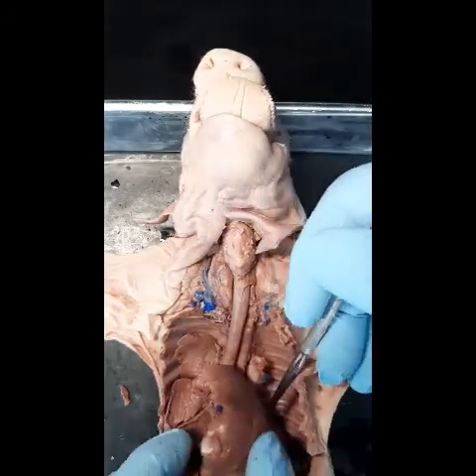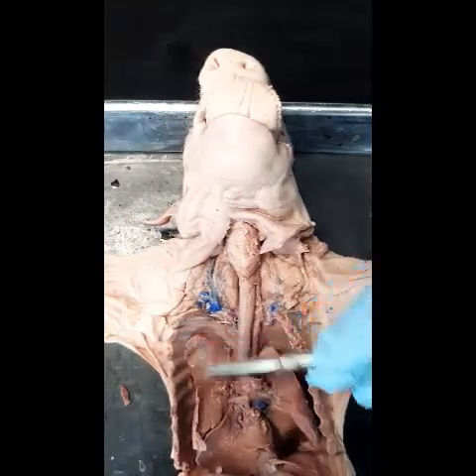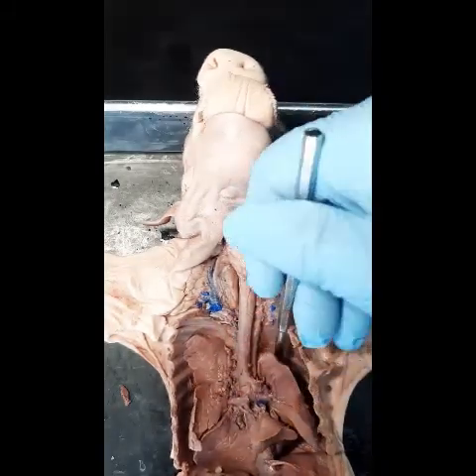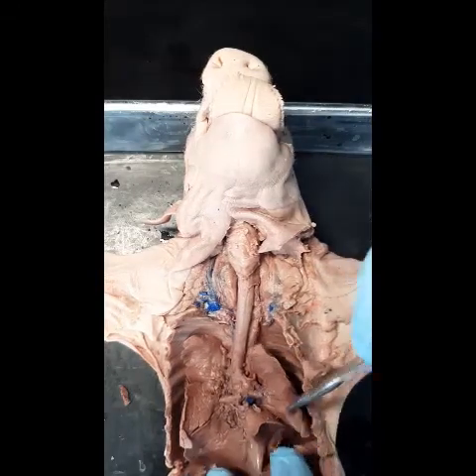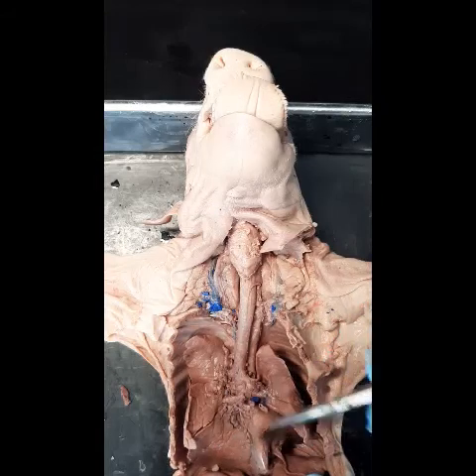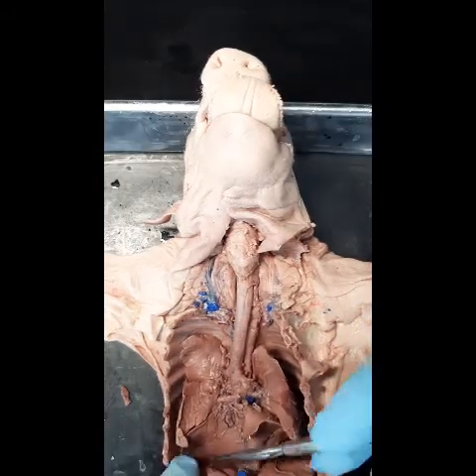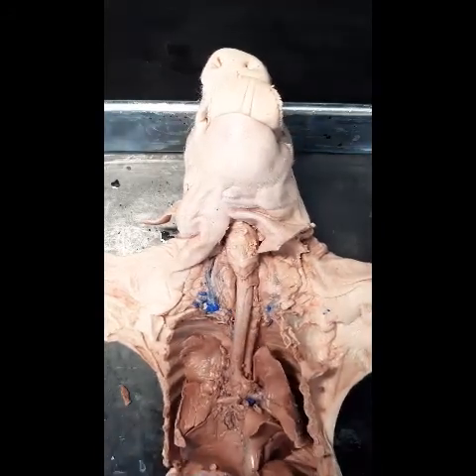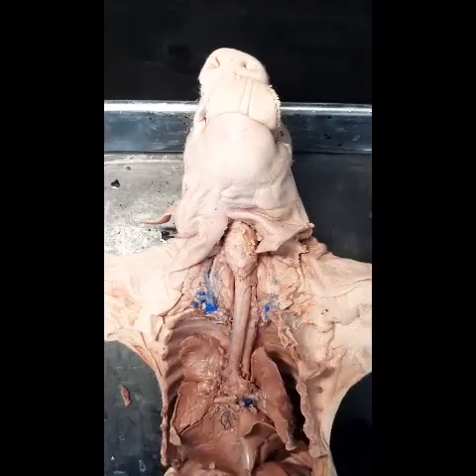In the fetal pig we can see we have seven lobes forming the lung. We have the left lung and the right lung, each having three lobes, and a small lobe called the accessory lobe. We also have the diaphragm. The diaphragm is one of the main organs involved in breathing, and it also divides the thoracic cavity from the abdominal cavity.